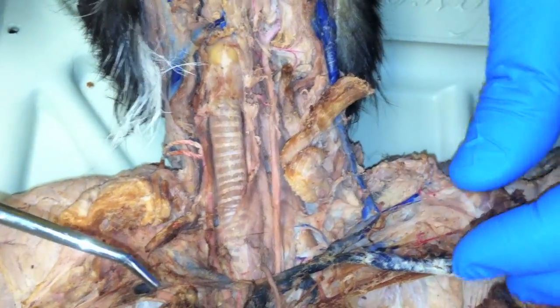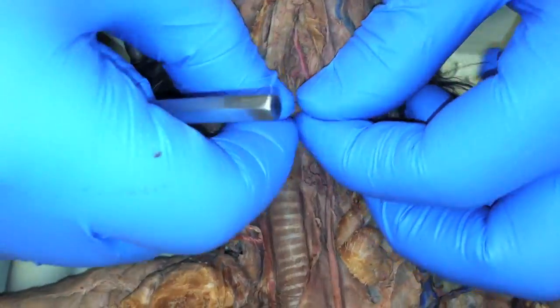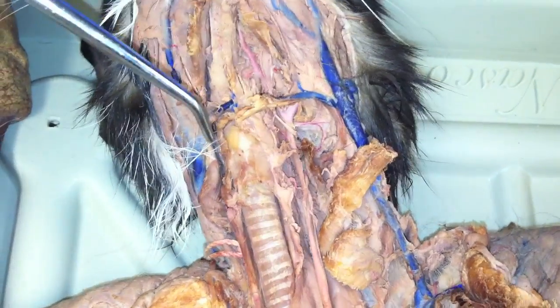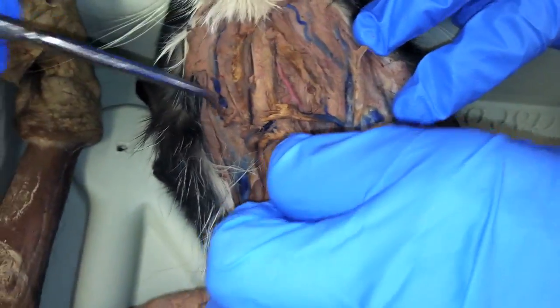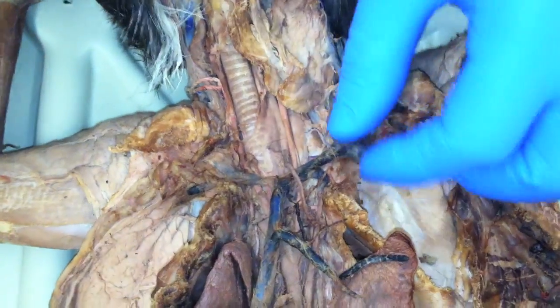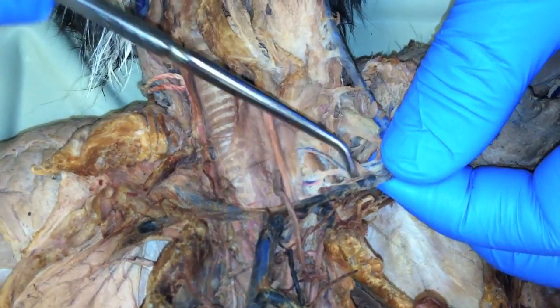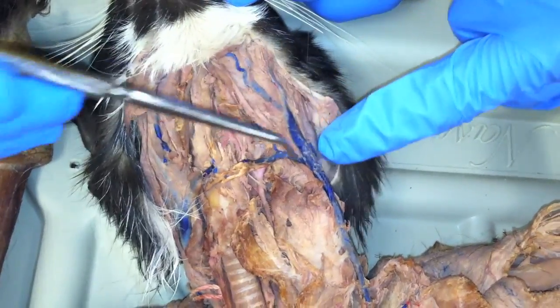And then we've got the internal jugular and transverse. Our transverse jugular is cut — it's the transverse jugular. And then these are your facial: posterior facial and anterior facial. And then we've got the lingual — that red one right there, we already went over that. So this is external jugular, internal jugular, transverse jugular, anterior and posterior facial.